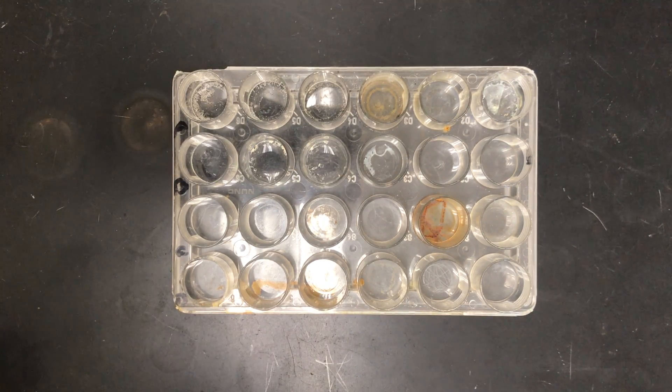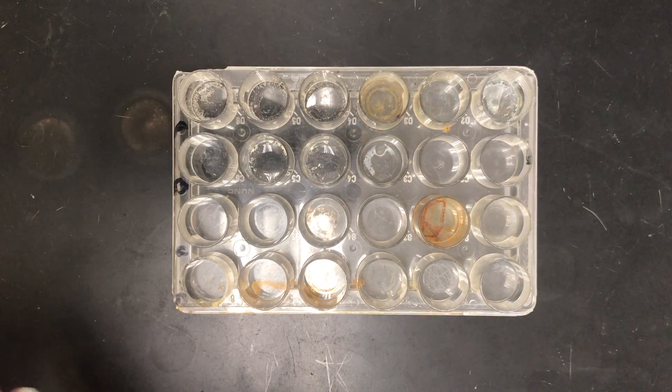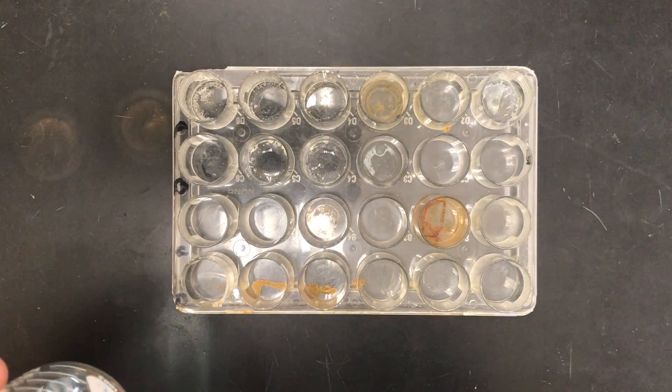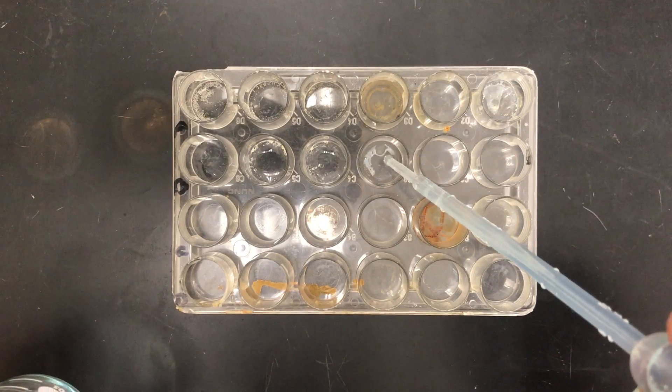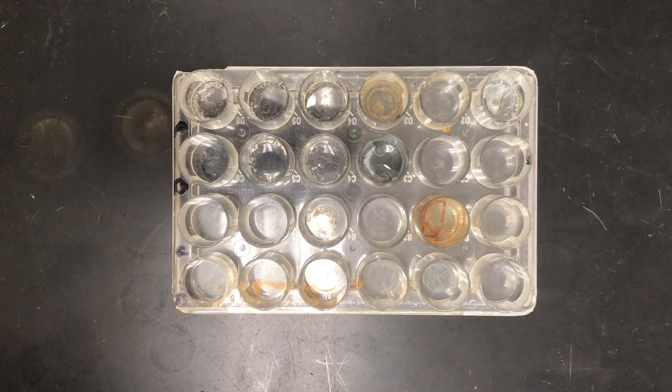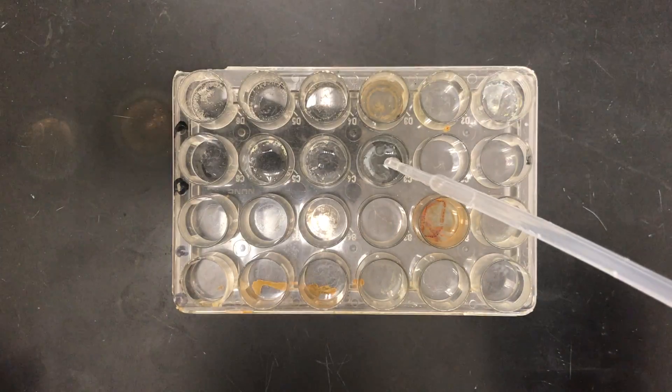And then we're going to do silver nitrate and sodium chloride. All right, so we got silver nitrate and sodium chloride.